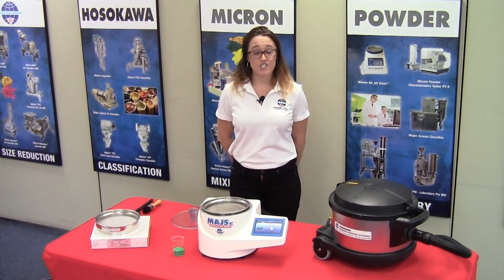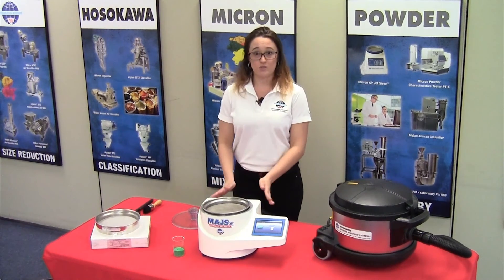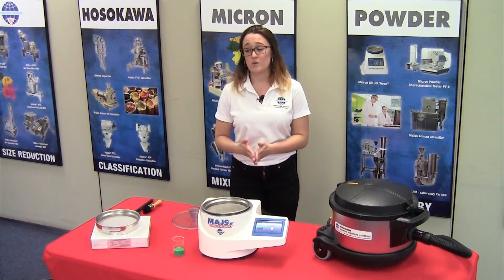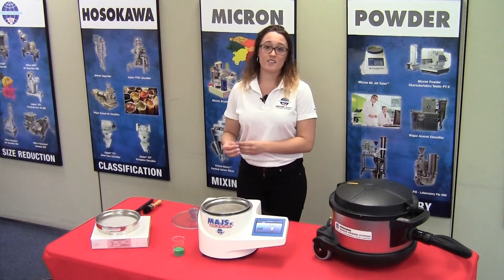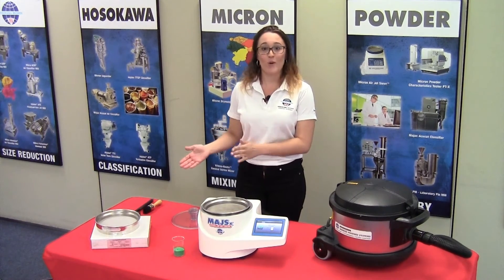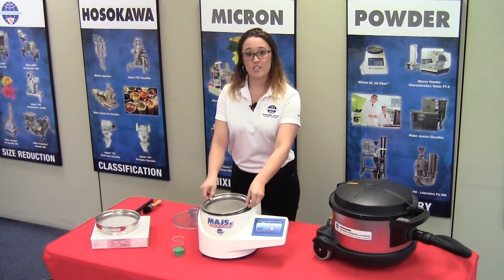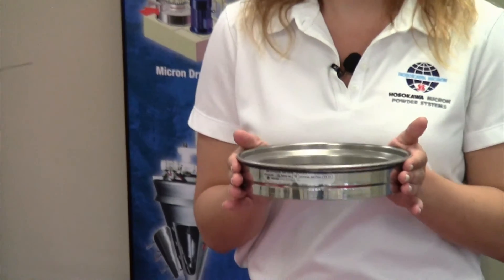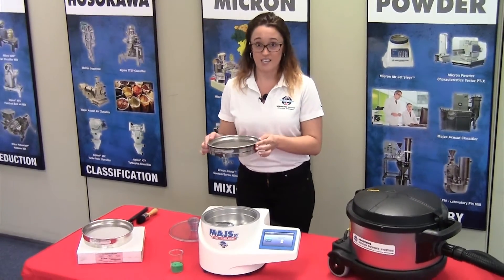After entering in your sieving parameters, we're going to introduce the sample to the Air Jet Sieve. There are multiple different ways that you can do this. You can either weigh the sample with the sieve screen on a balance, or you can weigh the sample by itself in a weigh boat and then introduce it. You also want to make sure you confirm the sieve screen size that you are using, so you get the correct particle size analysis.